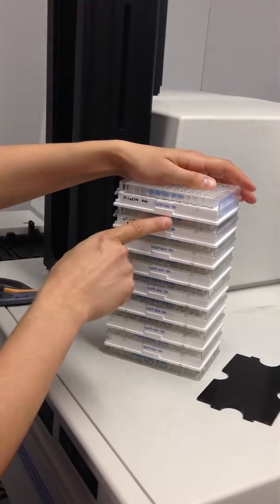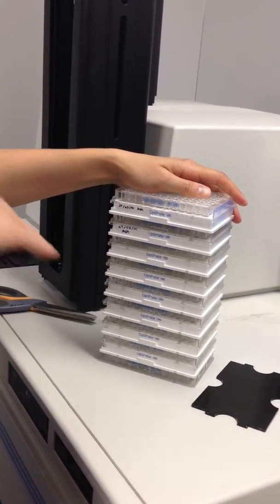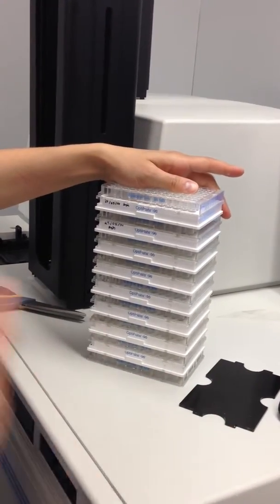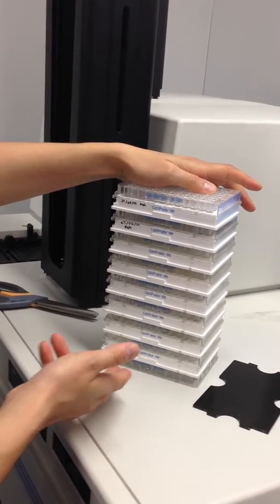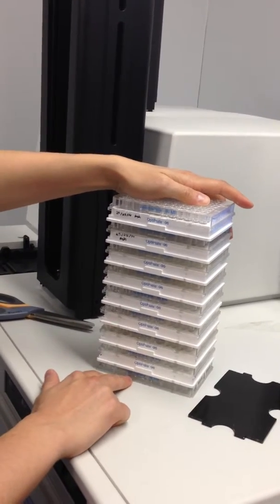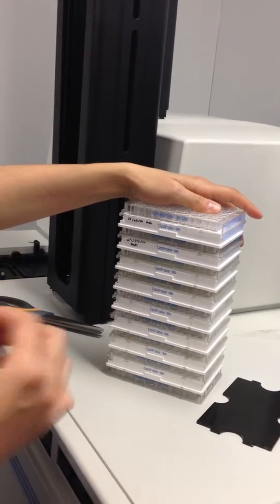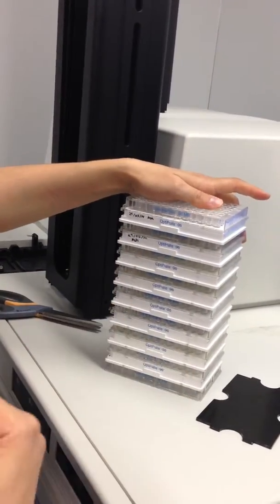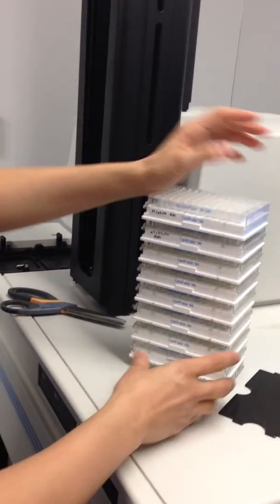The reason why we want to put a clear plate in between them is so that they can still have access to light. Otherwise, they would be in darkness, and we know that this will influence their rhythmicity. So the assay is set up to read every other plate, and to always skip the first plate. The assay is also set up so that it can sample only 8 plates per hour. So we have to put exactly 8 plates. If we put less, it would sample more per hour. If we put more, it's going to sample less per hour.